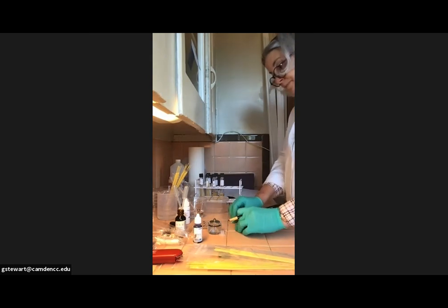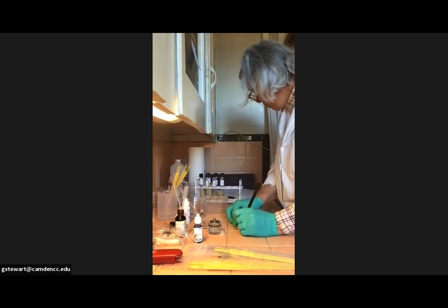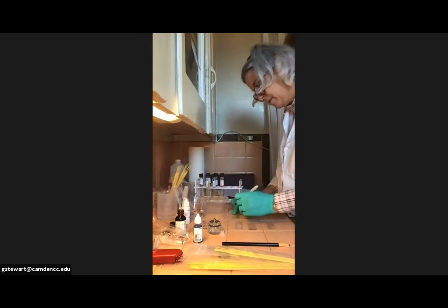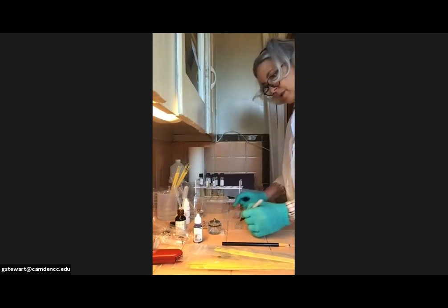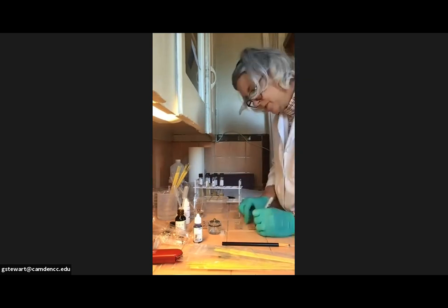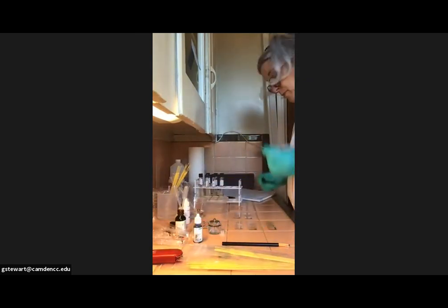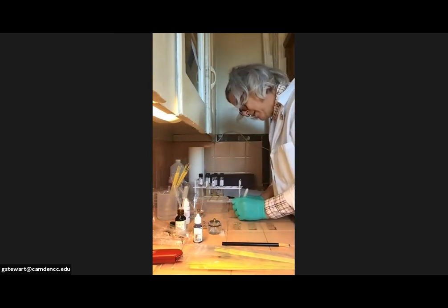If I were you, once you flip the slide over, I would number my slides 1, 2. This is tough. I think I'm going to use the Sharpie anyway. 1, 2, because it actually writes. 3, 4, and actually, no, you're supposed to label them 1, 1. My apology. 1, 1, 2, 2, and then this one I would just label tooth. And you'll remember because it only has one circle on it. And then you are supposed to label them A and B. So 1A, 1B, 1A, 1B.